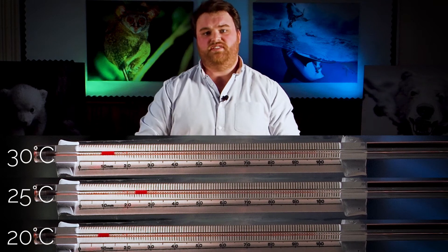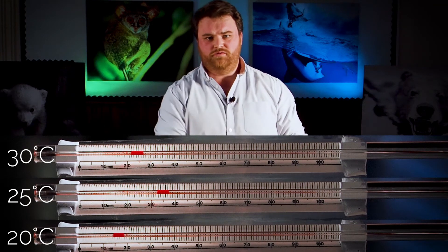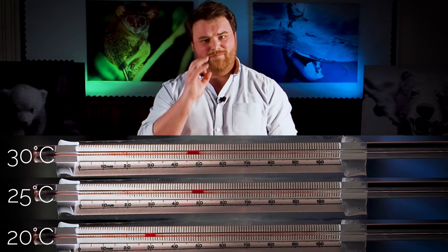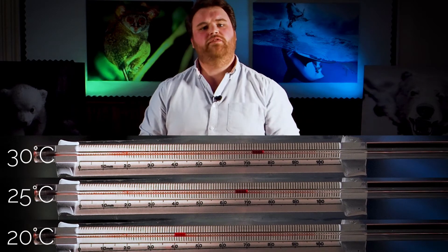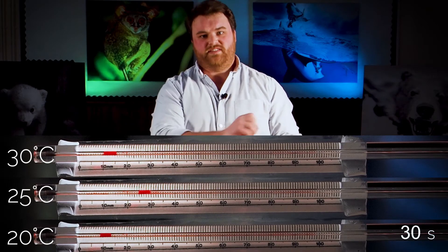As you can see, over time, as that oxygen was used up, the coloured water was drawn up the capillary tube — that's showing us respiration taking place. And because we know the diameter of the capillary tube, we can do some maths and calculate the volume of oxygen used per minute per gram of the organisms. And that is amazing.